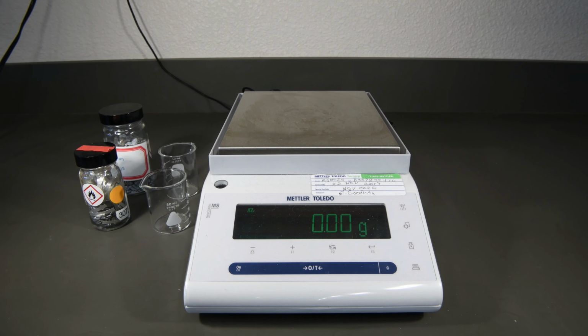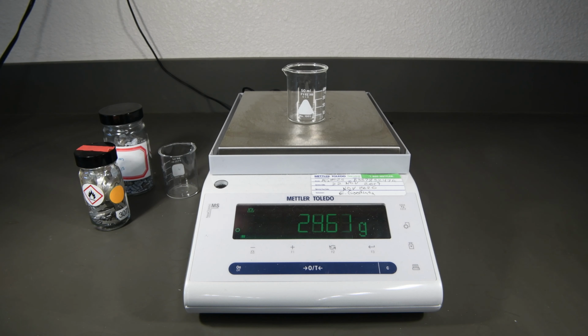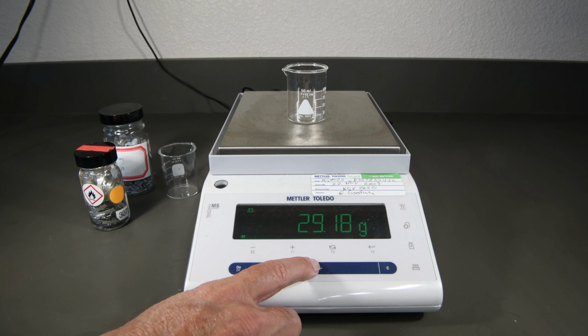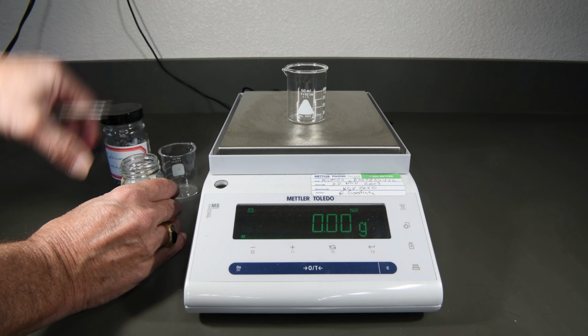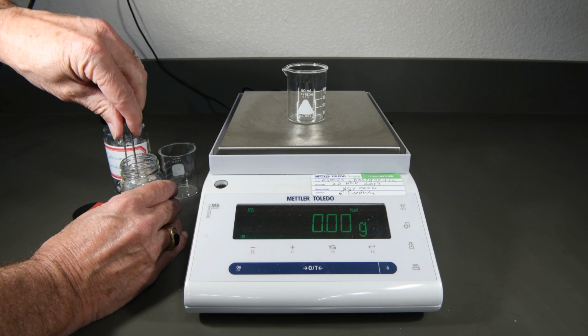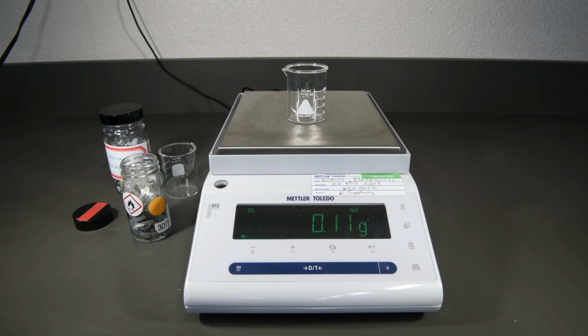All right, let's begin part A by weighing out a piece of calcium and magnesium. We want to weigh out about 1/10 of a gram of each of those to dissolve in hydrochloric acid. To make it easy, we'll just use the tare function on the balance. That will remove the mass of the beaker, and now we can weigh the magnesium directly. So we'll add a piece of magnesium, and it looks like that's pretty close to 1/10 of a gram, so that should be fine. It doesn't have to be exactly that, just in the ballpark.